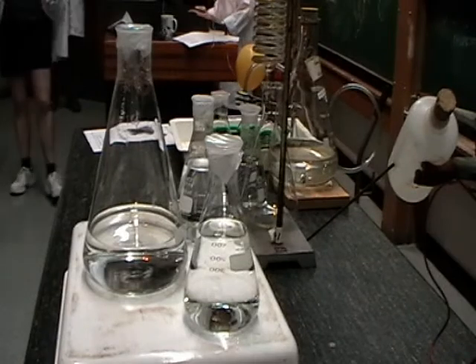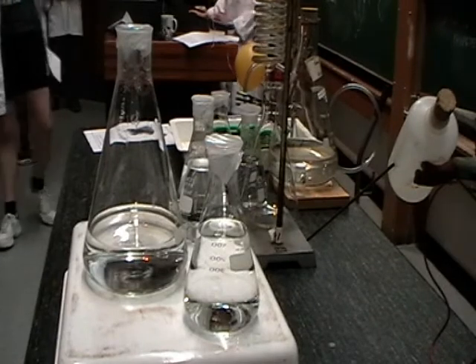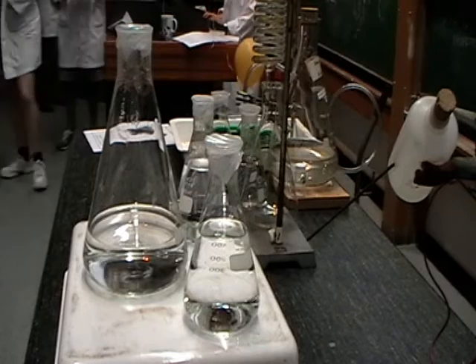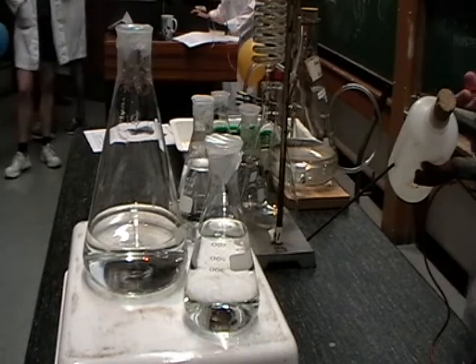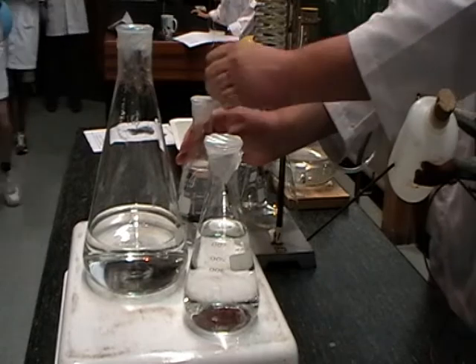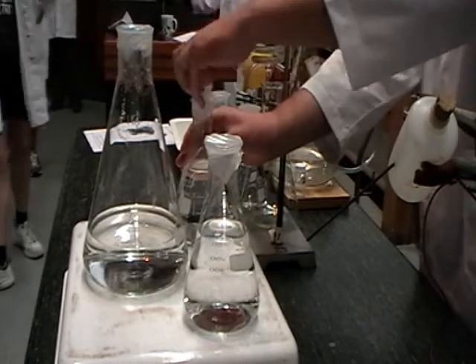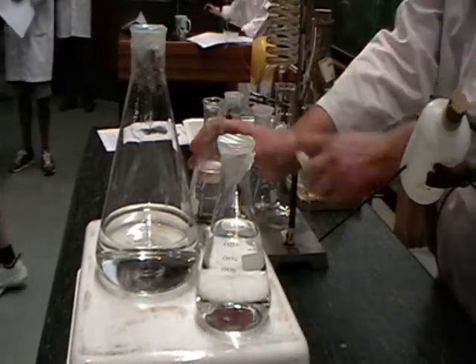The first experiment we're going to be looking at today involves equilibrium. It's known as the oscillating clock — you'll soon enough see why that is. Tony's going to be demonstrating it for us.